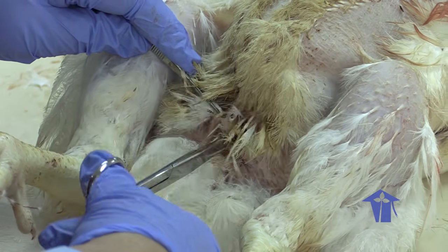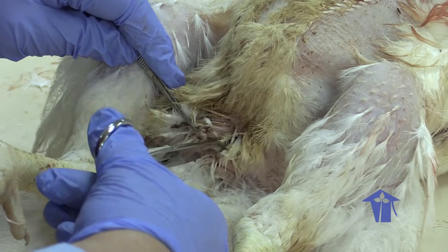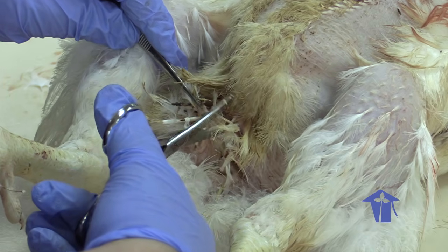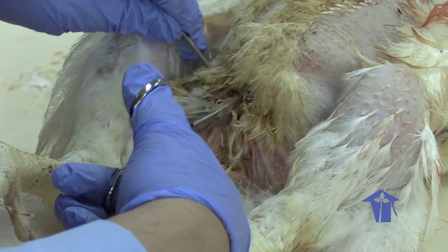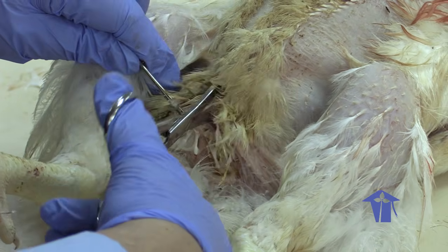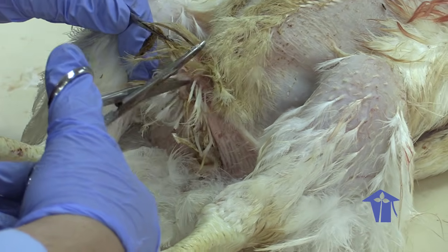So I'm sure there are people who are able to get a chicken open in a matter of seconds. In fact, my first knowledge of dissections used to come from looking at my mom cut and season meat.